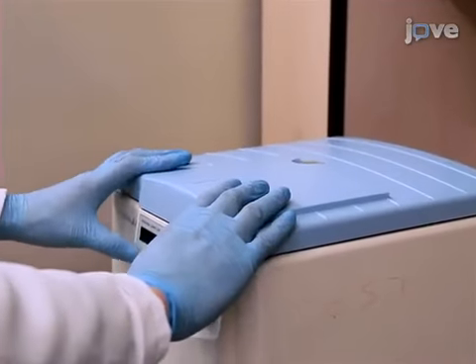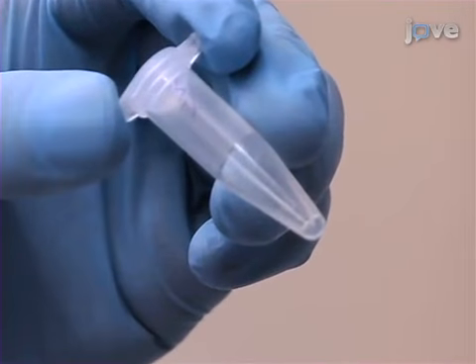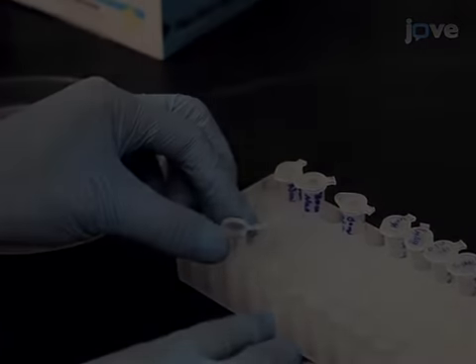When making the injection mix, be sure to centrifuge it and transfer the top 5 microliters, free of debris and other contaminants, to a fresh tube for injection. Load injection mix and empty plasmid into an injection pipette by capillary.